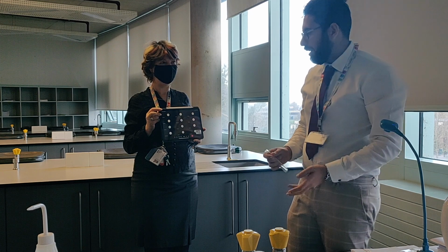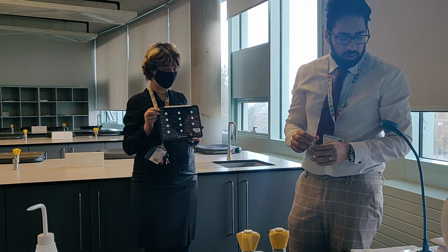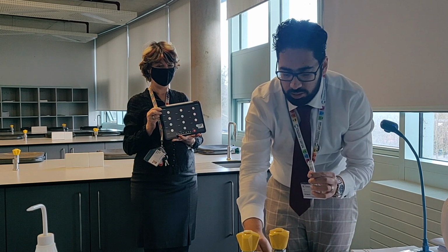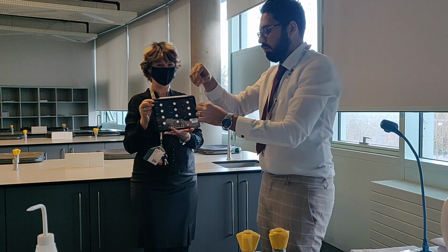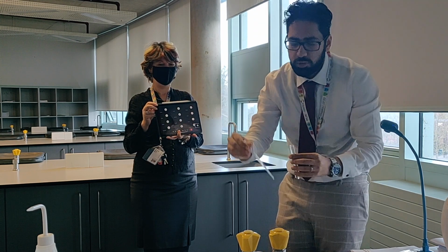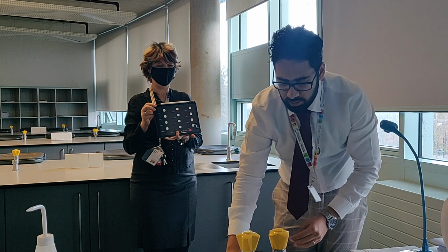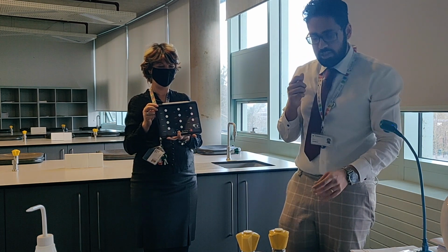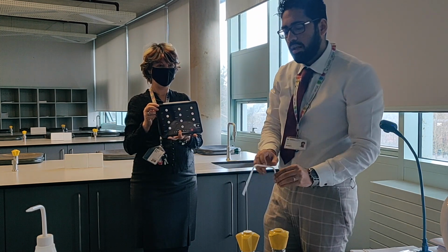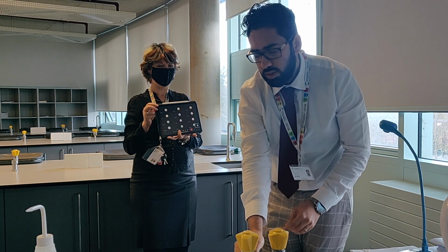Right, okay, so we're going to do test 5, testing for carbonate ions. So this is including lime water, so you would have known this test from probably GCSE. So we're going to start off with lime water, 2 centimeters cubed in a test tube. So 1, 2, I'm going to do it by drops. I'm going to do approximately 2 centimeters cubed. Okay, so I have that ready in a test tube holder. Now I'm going to react together sodium carbonate and hydrochloric acid. And I'm going to stopper it after, and then I'm going to place the delivery tube into the lime water, and we should see what happened.